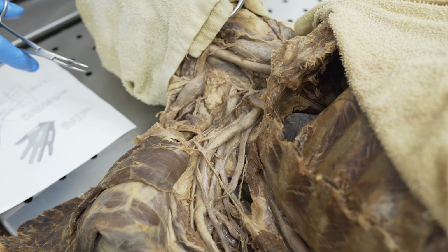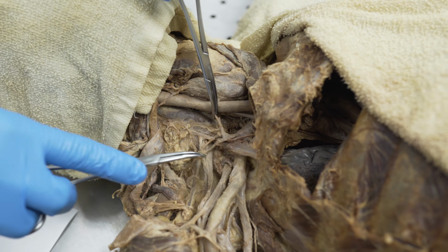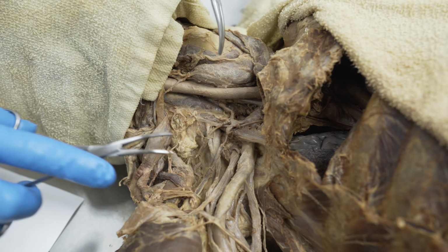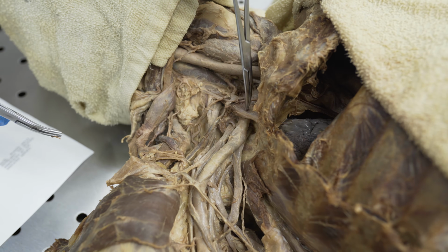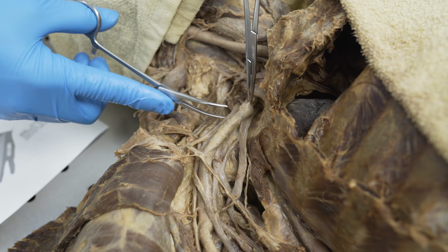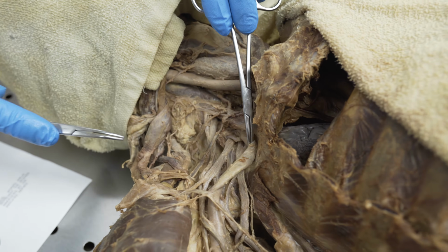of this area here. Notice we can still see here's that thyrocervical trunk and a couple of branches off of that. Here's your anterior scalene muscle coming there, right? So just so we can orient ourselves, we can see subclavian artery going underneath anterior scalene coming down here. So we're going to, for the most part, hold the artery out of the way so we can expose this area right here.